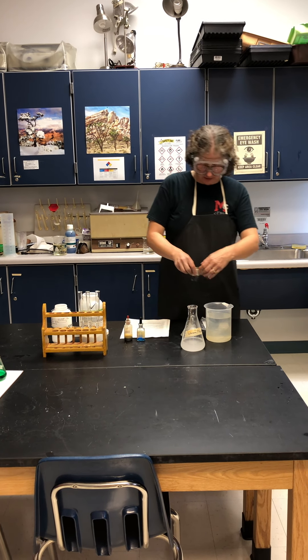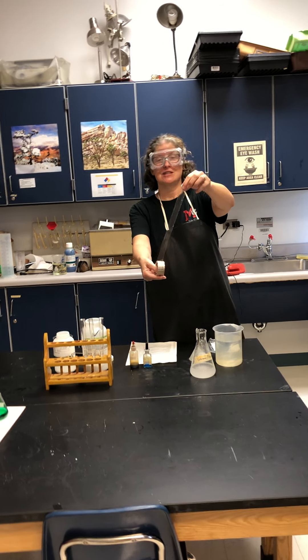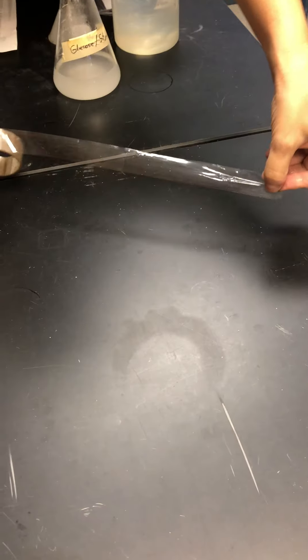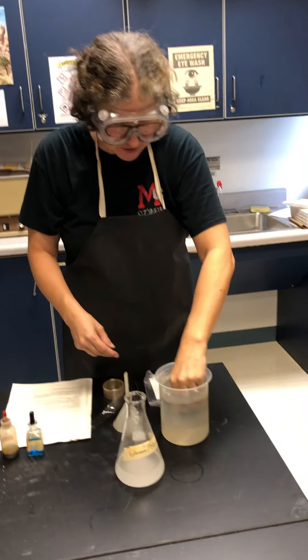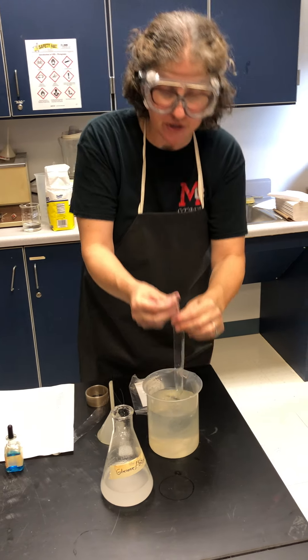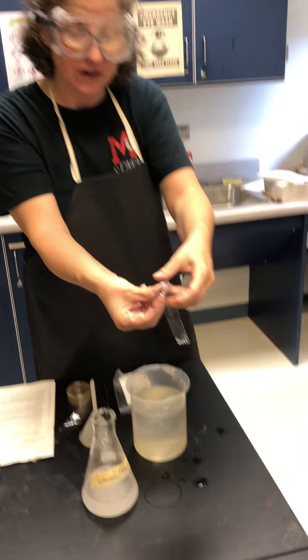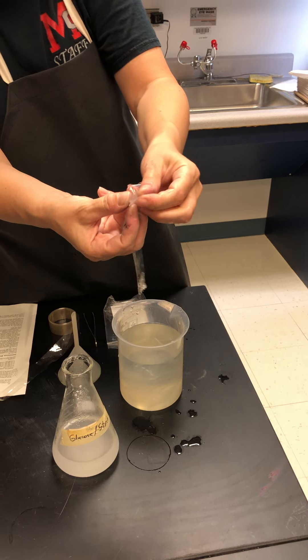Dialysis tubing doesn't look like much — it looks like a flat piece of plastic. But if you soak it for a while, you swish it back and forth with your fingers and find that it is hollow. It's a hollow tube.